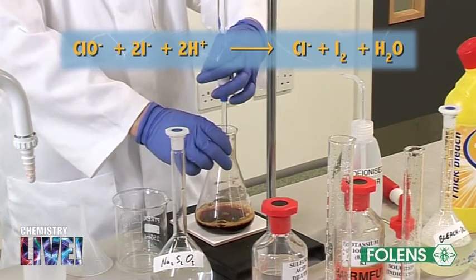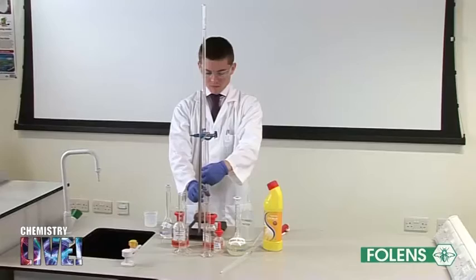Carry out the titration in the usual manner until the solution in the conical flask becomes pale yellow.